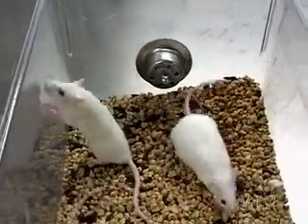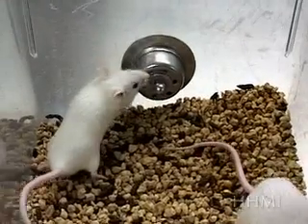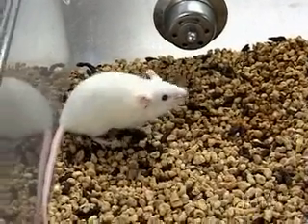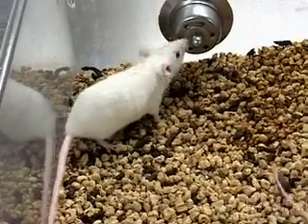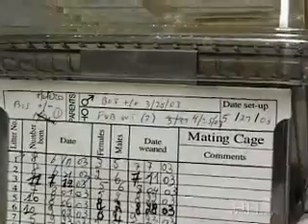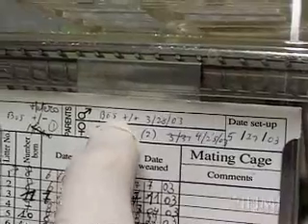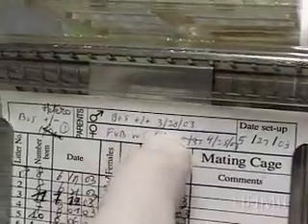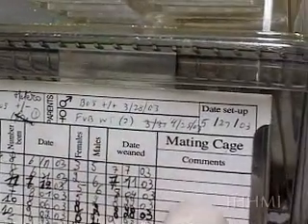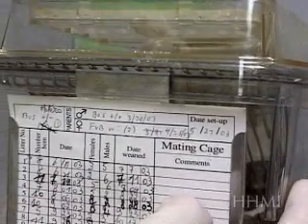Mice that have the transgene are bred with wild type mice. The offspring are again tested for the presence of the transgene. It is important to check that the transgene can be stably transmitted to the next generation in order to establish a line of mice that carries a new gene.